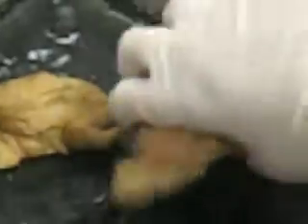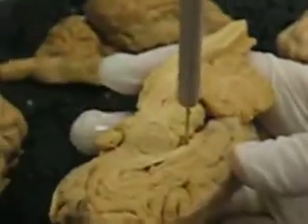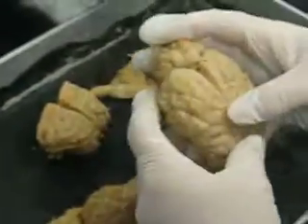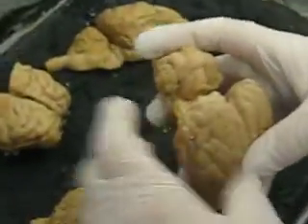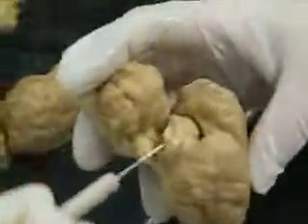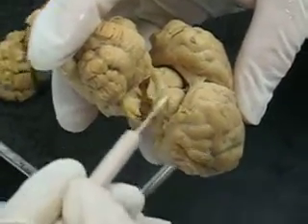Third ventricle. Third ventricle, that's right in here. Fourth ventricle, right in there. Corpora quadrigemina. Be very careful on this one here. If you pull it, deflect it away, corpora quadrigemina is this structure here. Is that like a midbrain? Big ball-like structure. It is not part of the cerebrum, and it's not part of the cerebellum. This is the corpora quadrigemina.